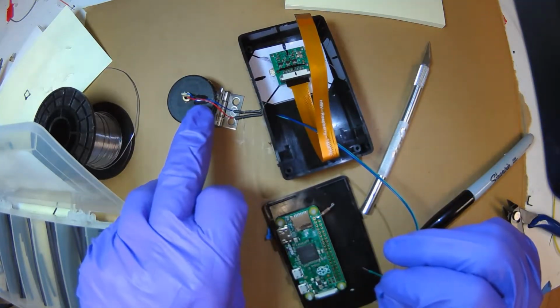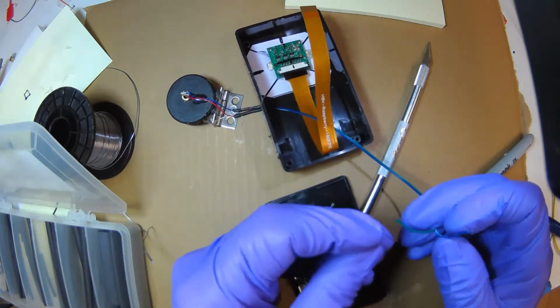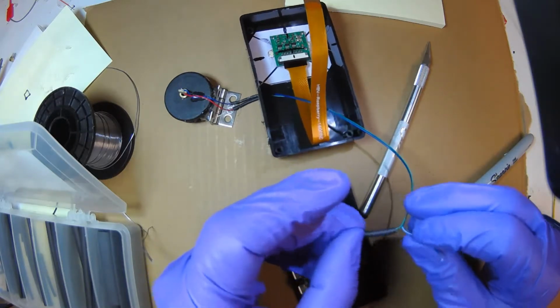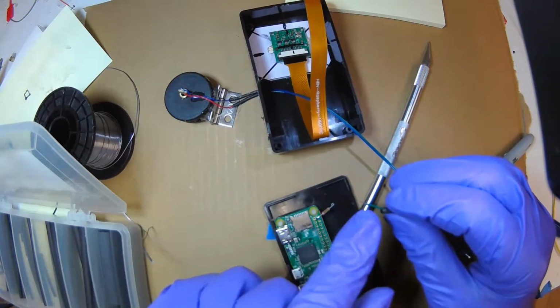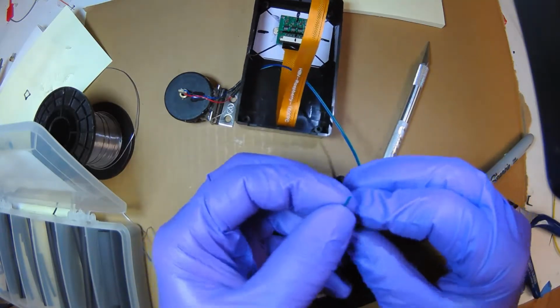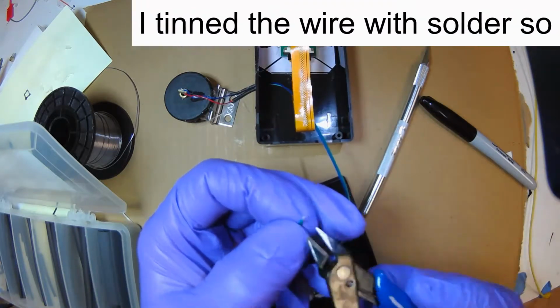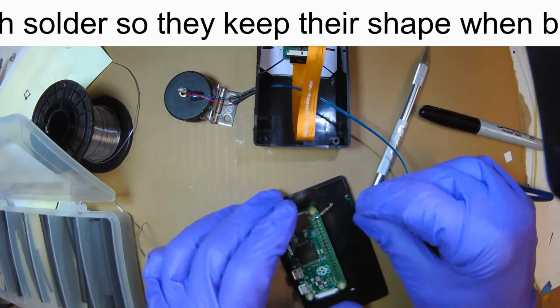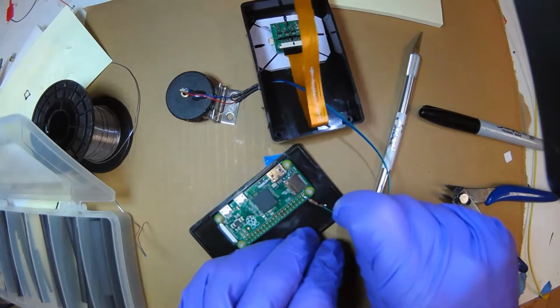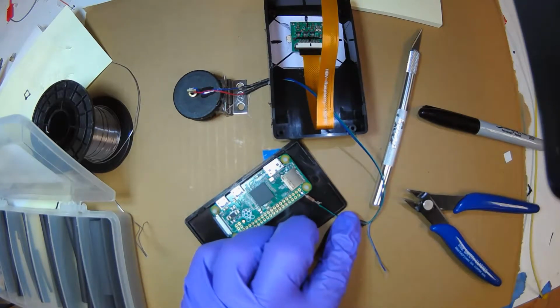Double check. We have red is positive. It goes to green. So green is positive. And I'm going to give it a little longer because wire heats up and it was a tight fit, so I don't want this to shrink prematurely. And I'm going to make a little loop by grabbing this. So I got another loop here. Loop meets loop.